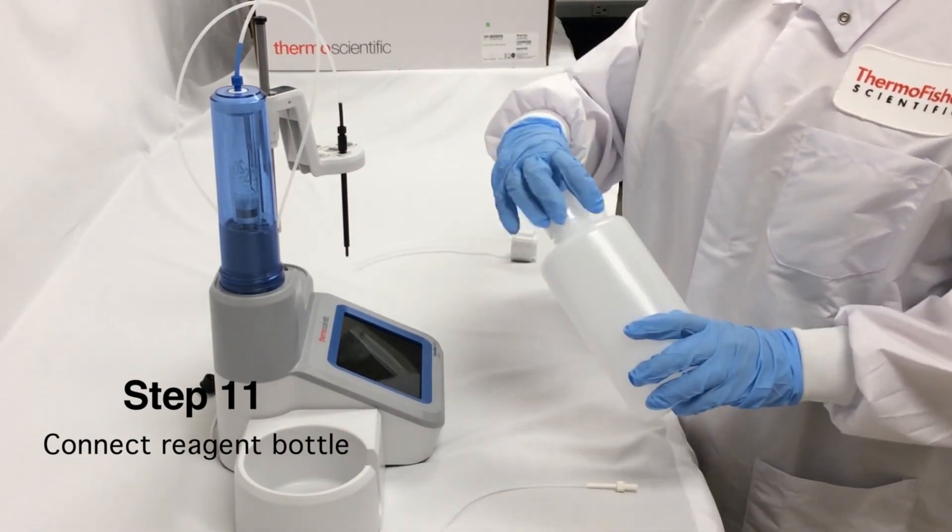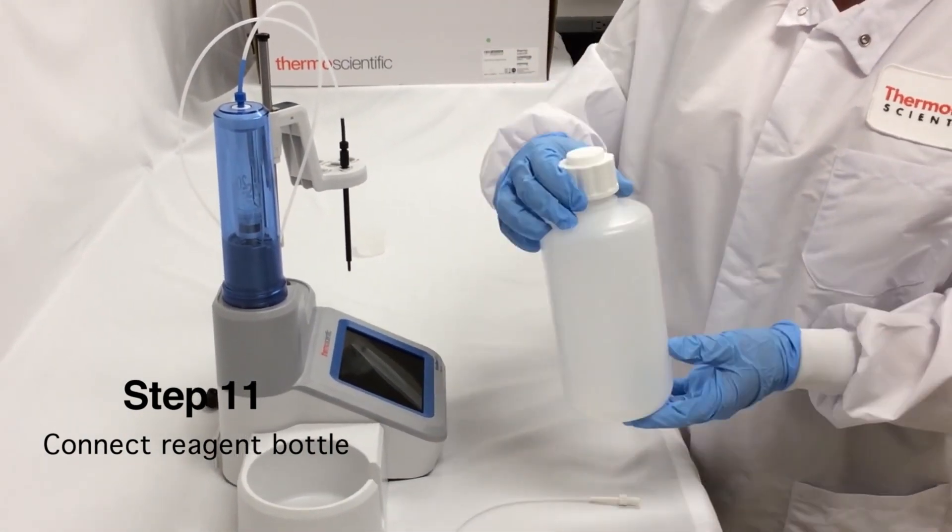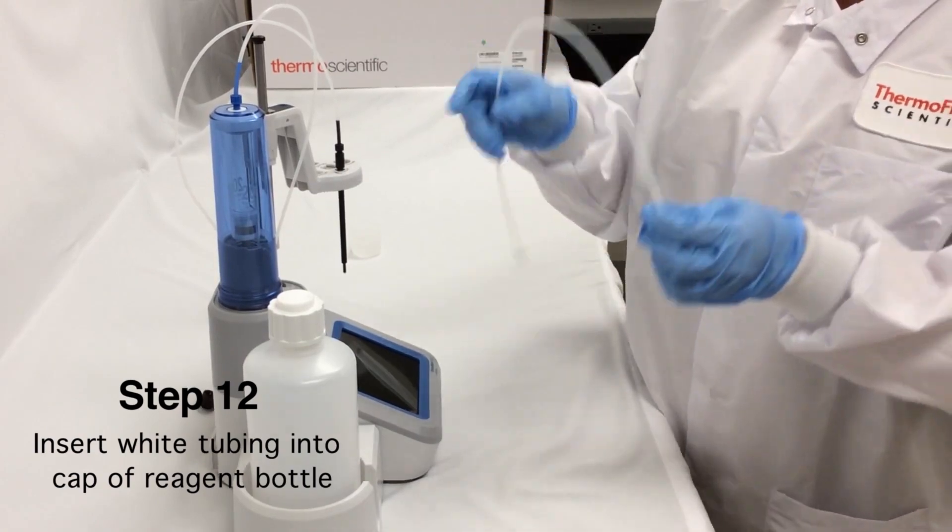Take the reagent bottle and white tubing.